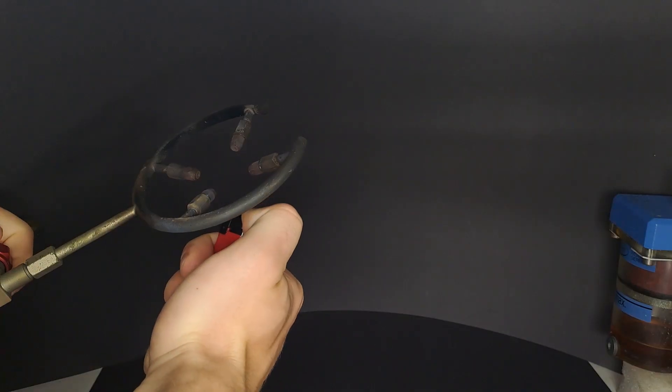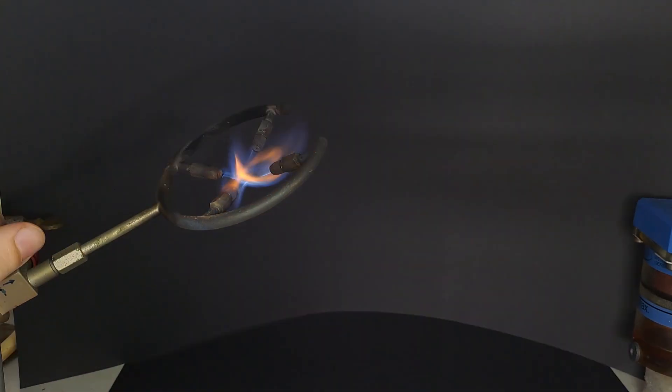Let's skip the magnesium oxide sticks since they're all dirty anyway. However, we can use a fresh needle made from iron, nickel, and chromium.